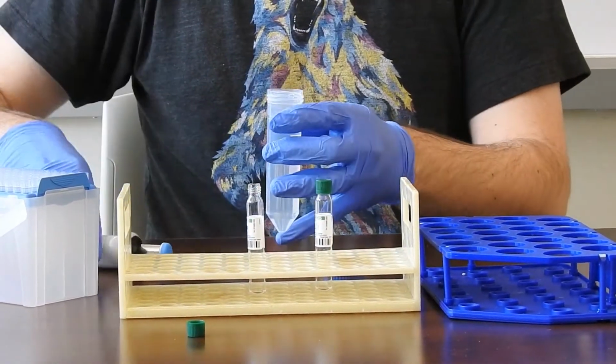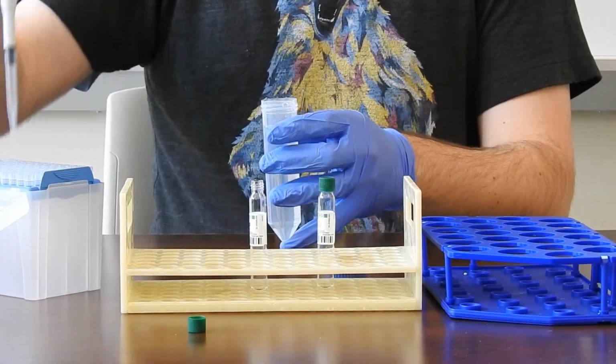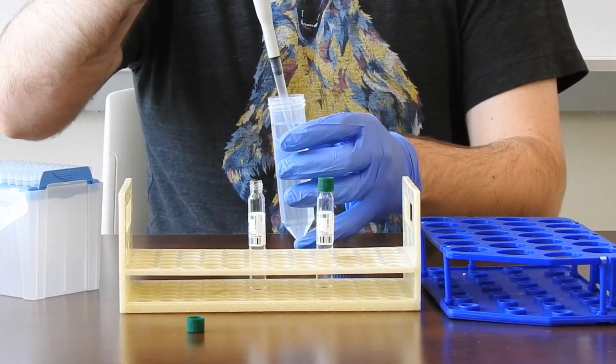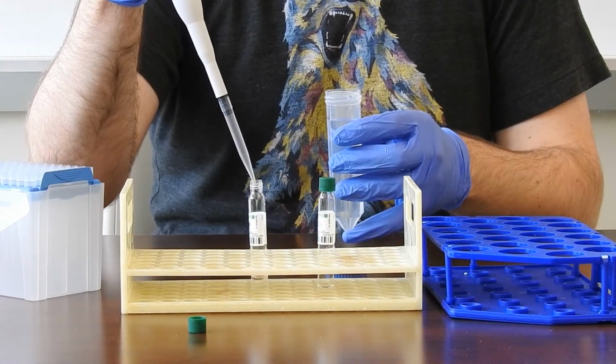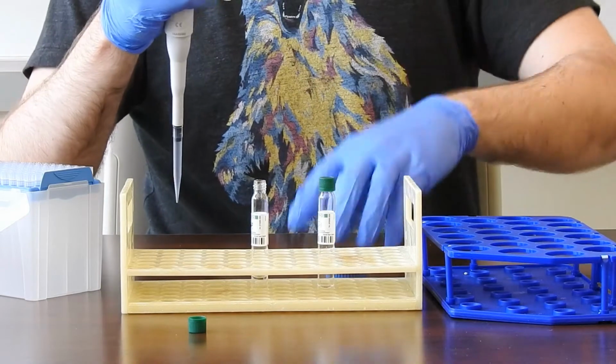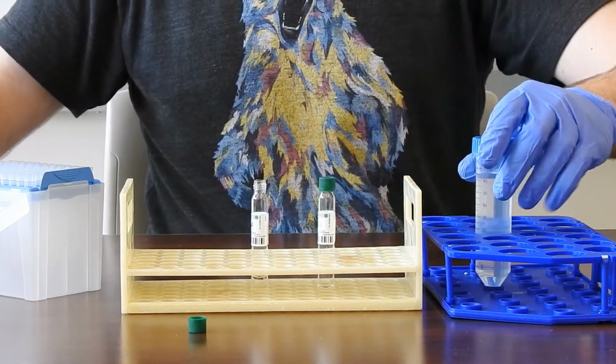The first step, once you've opened the vial, is to pipette a small amount of sample into the vial. Here, the sample will mix with the acid and alter its pH, which is important for later steps in the process. For Stream Team, we'll often do this step for 10 to 15 vials before we move on to the next part of the process.